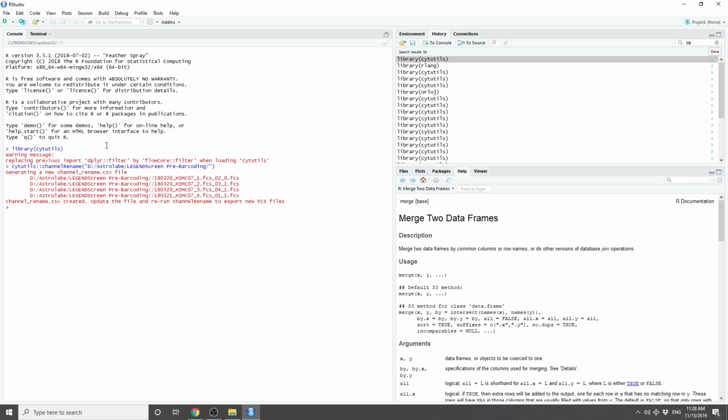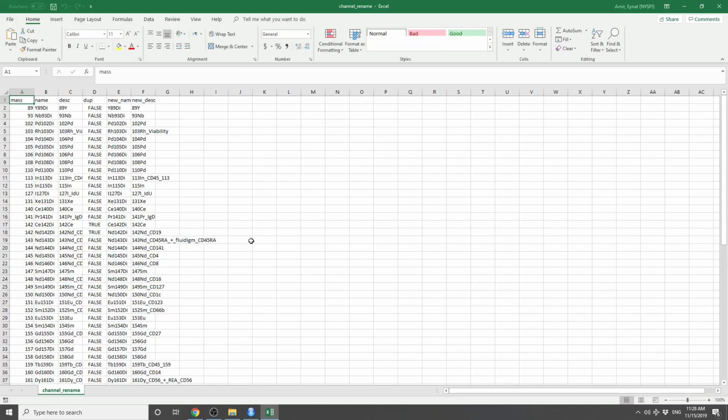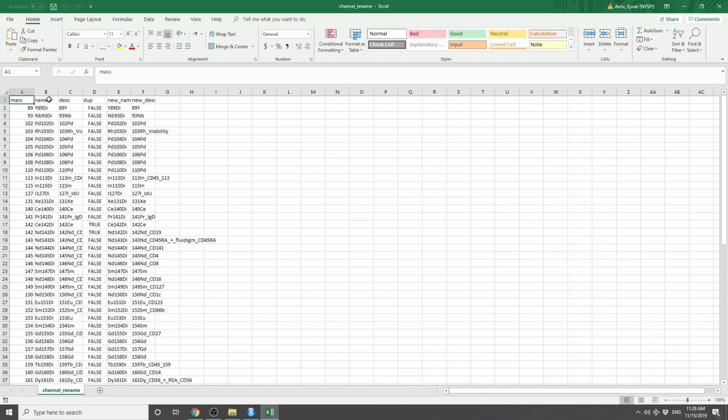And when you run channel rename on a directory with FCS files, it's going to read the headers from the FCS files and combine them into one big spreadsheet, which now exists here. And when I open that spreadsheet, it's going to show me each one of the masses, each one of the descriptions, and give me an option to rename them into new names or into new descriptions.